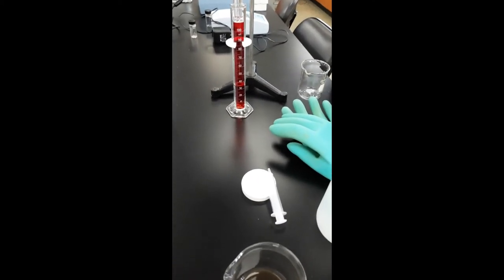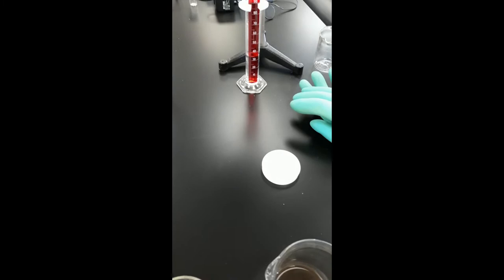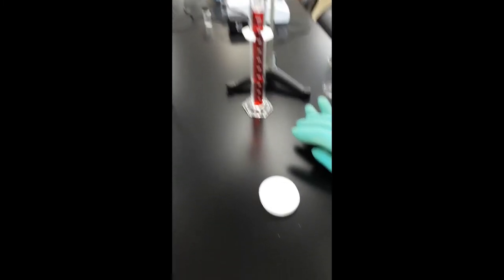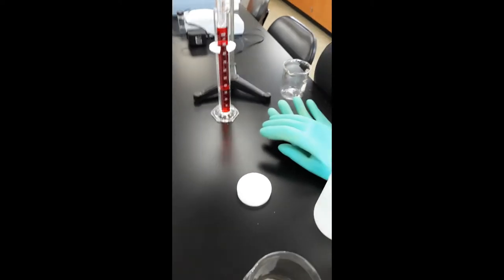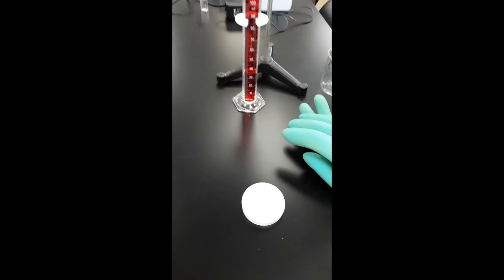Look how much water separated. We had 50 mils, we already got 35 mils. So one of the things we're actually going to try here is rather than one mil, since it coagulated pretty well, I'm going to try a half a mil of polymer.